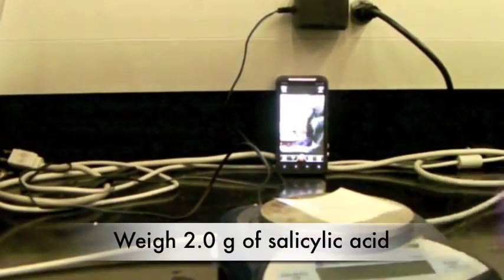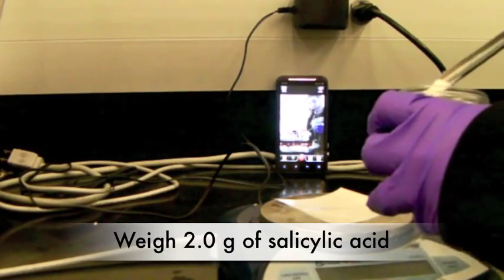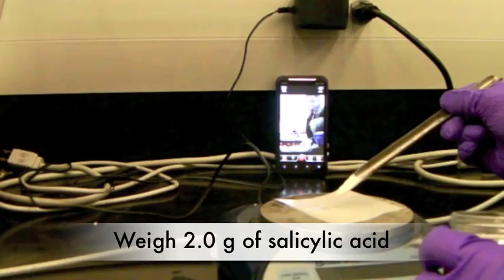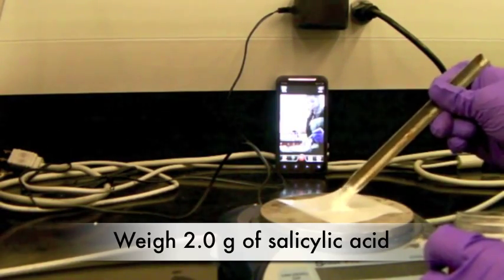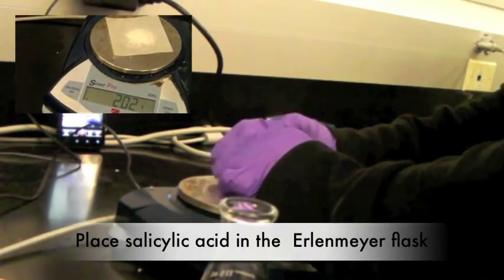Weigh 2 grams of salicylic acid and place it in the 125 ml Erlenmeyer flask. Make sure to record the actual amount you weighed.